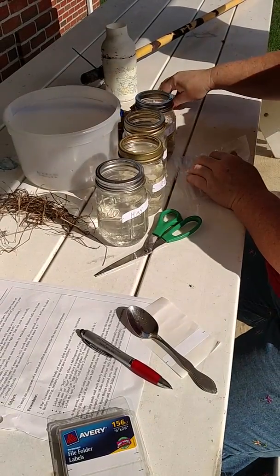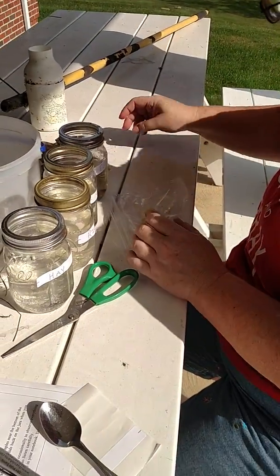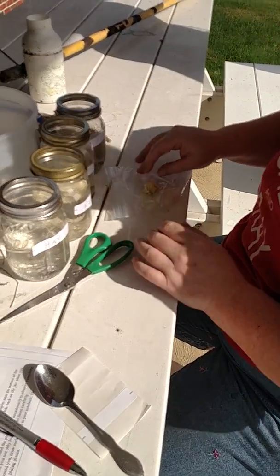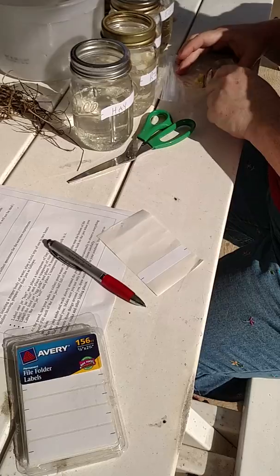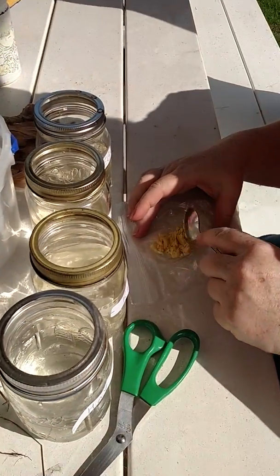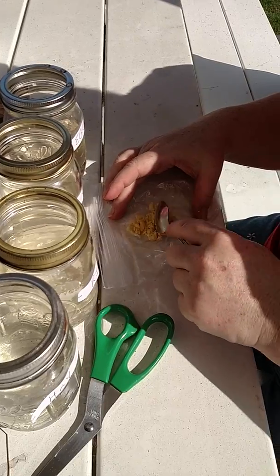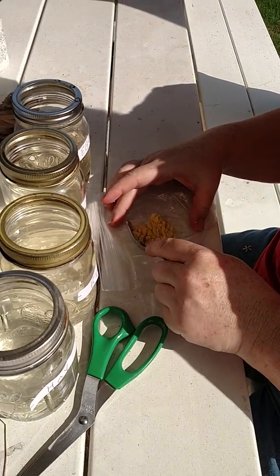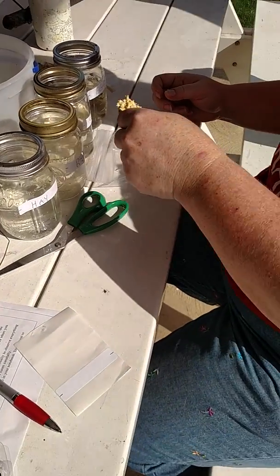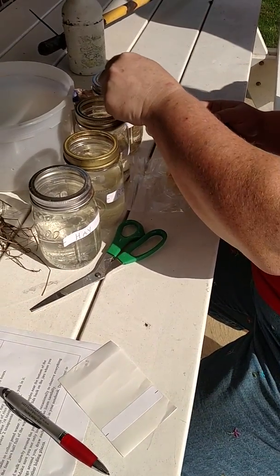I've got some egg yolk — I had a boiled egg. And what I want to do is mash it up or cut it up so the protists can get to more of the area. Egg yolk breaks up very nicely. We'll take a teaspoon of that — about that much — and put it in the jar with the egg.